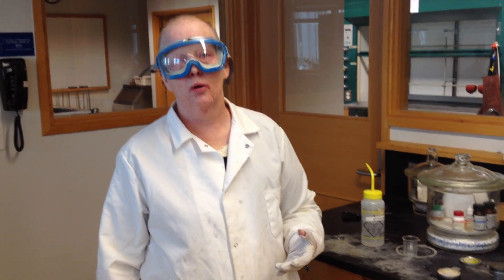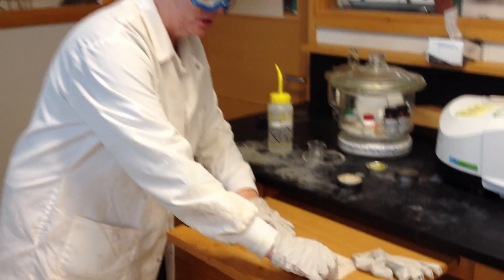Sometimes we will run something called a KBR pellet, but we only do that when the film doesn't work, because this new instrument is very sensitive and we can get away with very little sample on the plate. We universally use sodium chloride plates or sodium chloride discs.